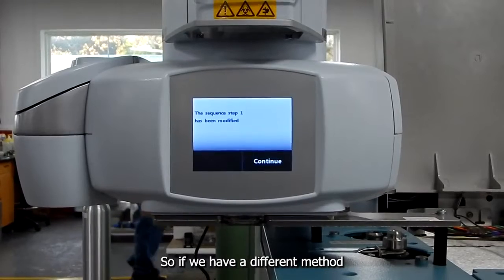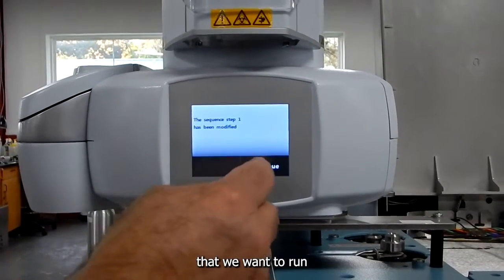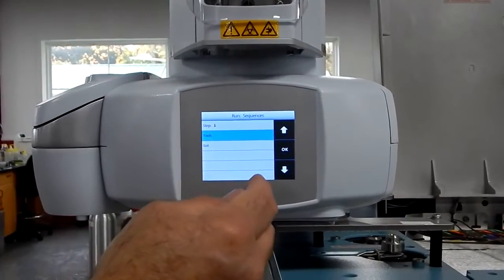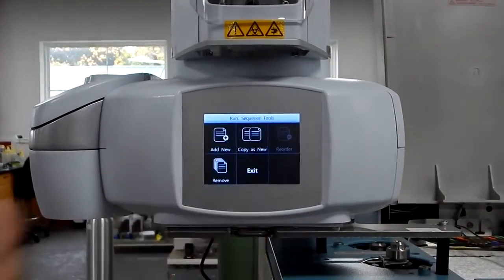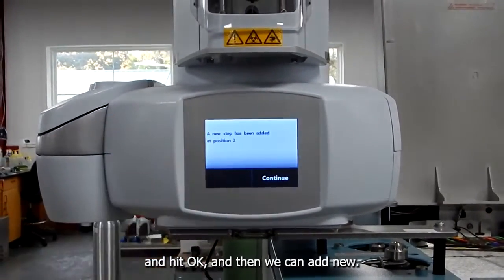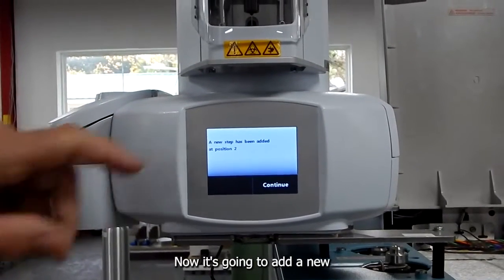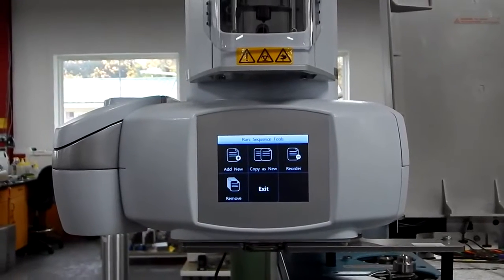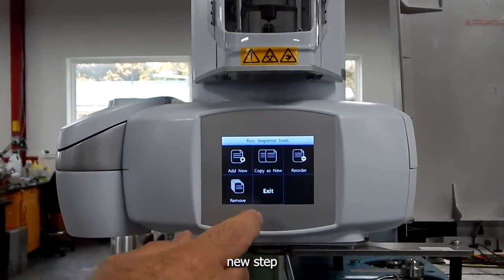So if we have a different method that we want to run, we then go down to Tools and hit OK, and then we can add New. Now it's going to add a new step.